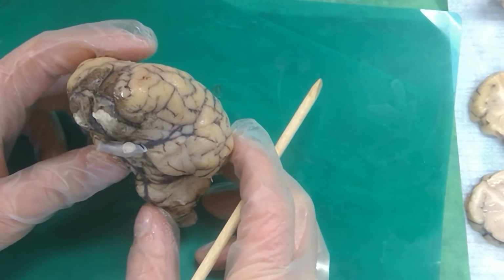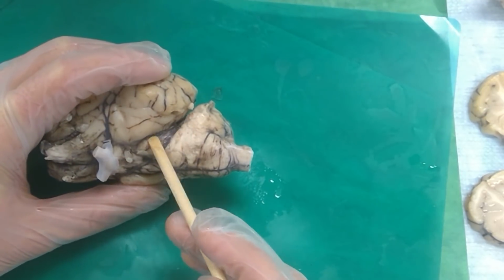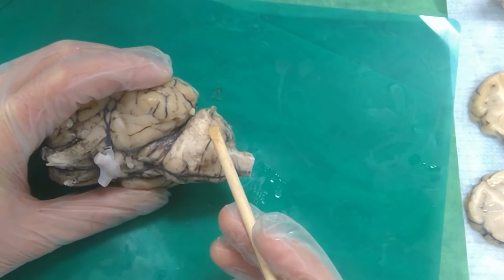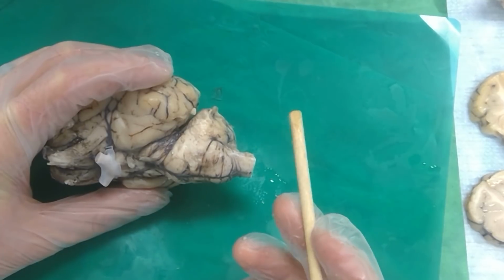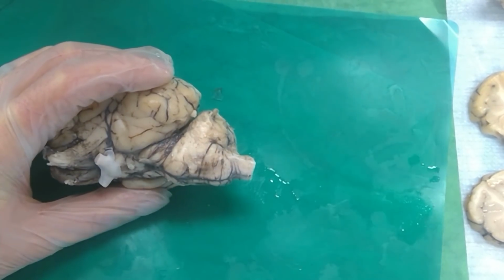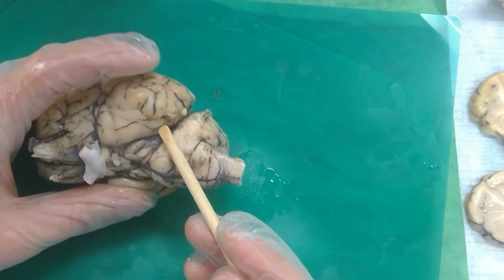All right, did we miss anything? What about the brachium? Oh yeah, okay, so name these fibers right along here. Brachium pontis. And there is a cranial nerve that's normally coming off right here. Trigeminal. We're just going to ignore the trochlear. On the trochlear, it gets ripped off a lot of times, and so I just figured it's easier if we don't worry about it. Does the trigeminal nerve come from the? It comes from the metencephalon, because it's coming off the side on the pons right there.